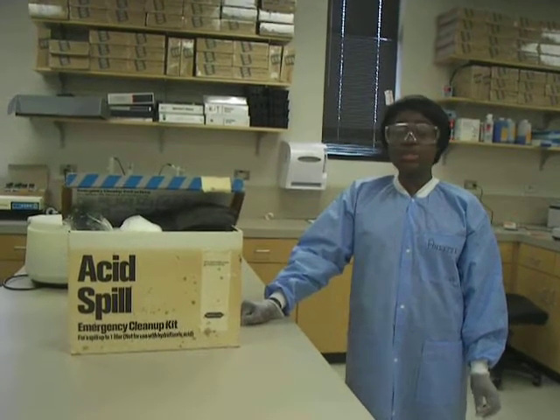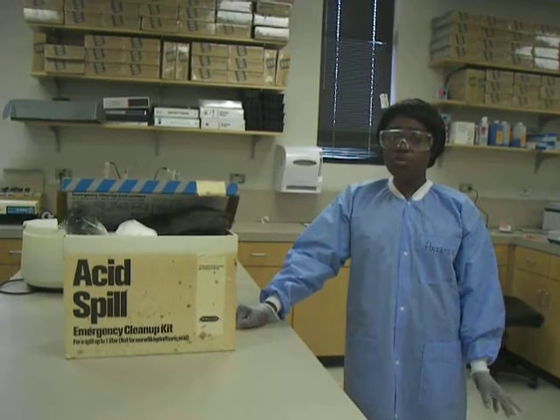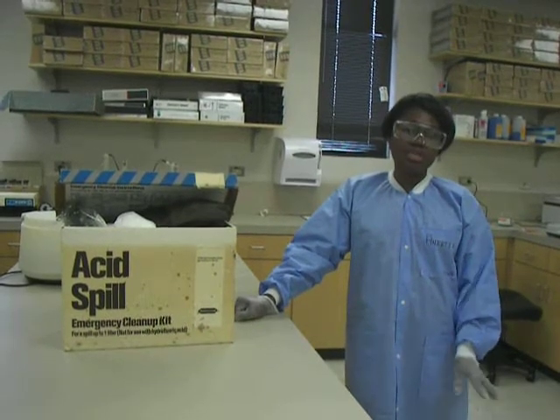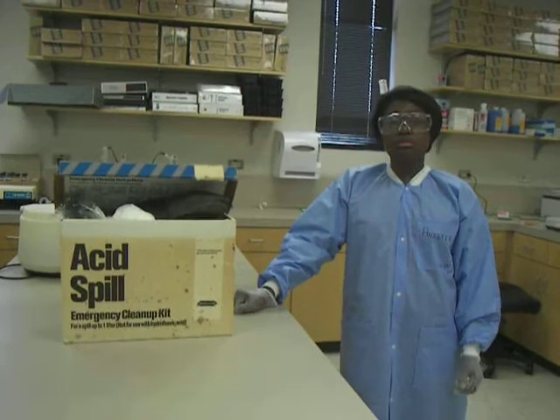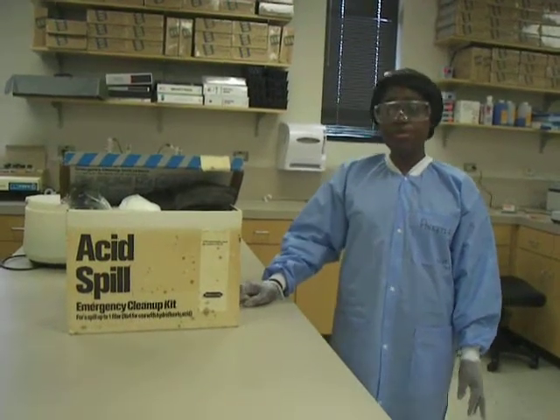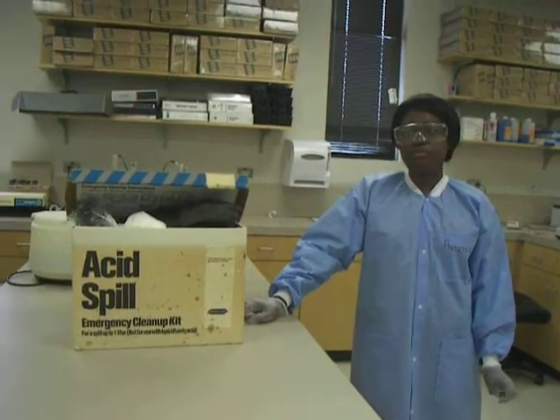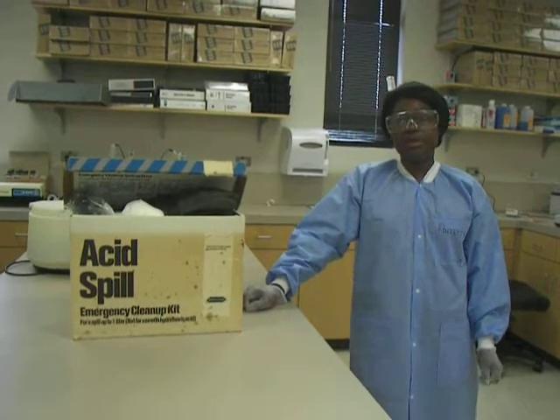There are two types of spills: manageable and unmanageable spills. The manageable ones are those that do not spread rapidly, and they are the ones that do not cause serious danger to the lab personnel or the environment. They are also spills that can be managed by the lab personnel without assistance from the emergency department.